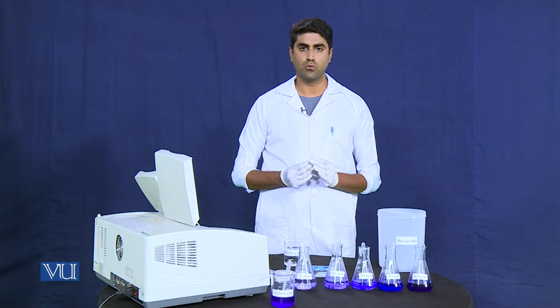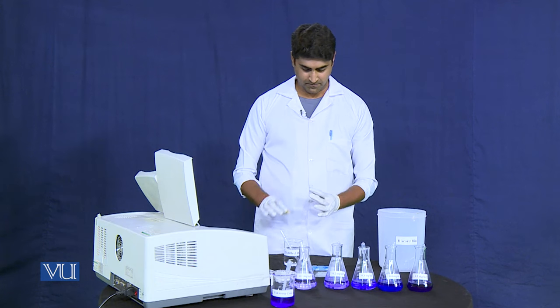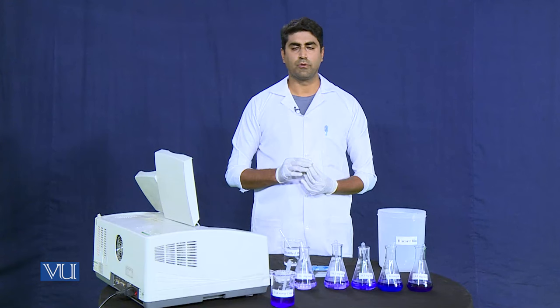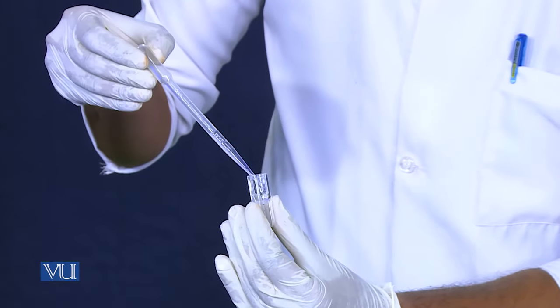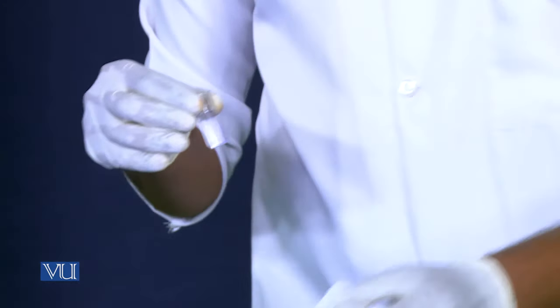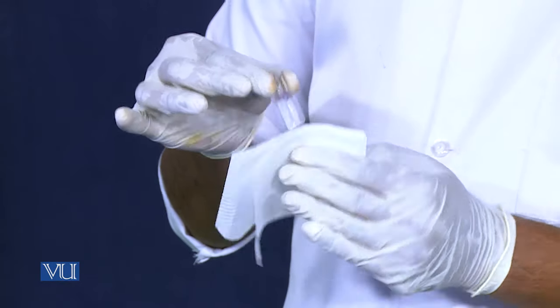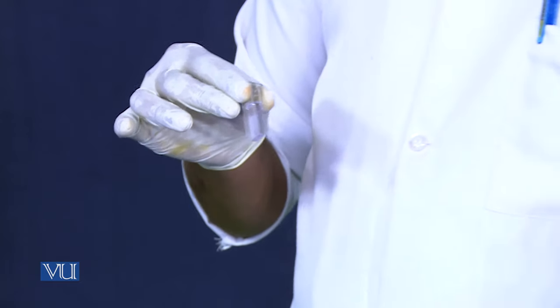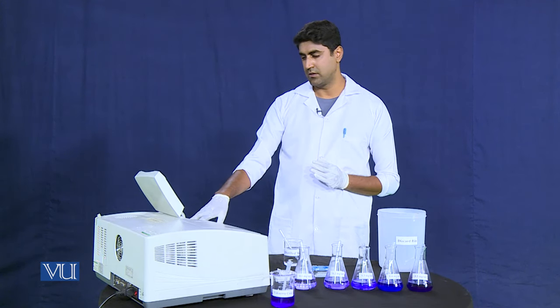Before taking the absorbance of the second dilution of potassium permanganate, we need to wash the glass cuvette with distilled water. Now we will take the absorbance of the second dilution of potassium permanganate, which is 0.2 mg/mL. Before placing it into the holder, we clean the transparent side of the glass cuvette with tissue paper so that maximum light from the lamp can pass through it. We close the cover and press the start button to take the absorbance.